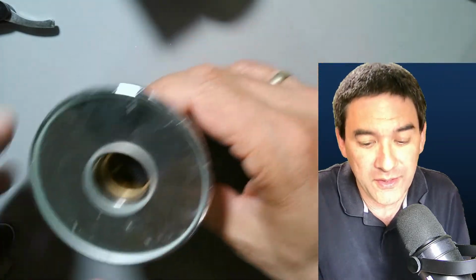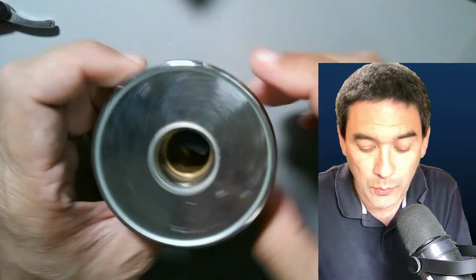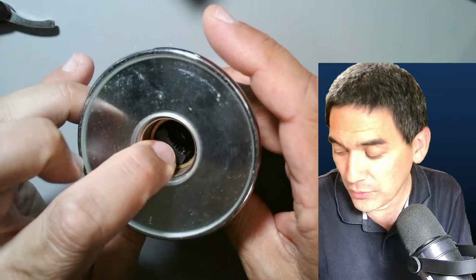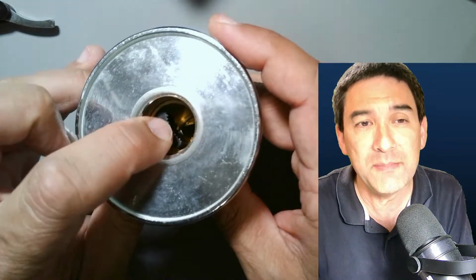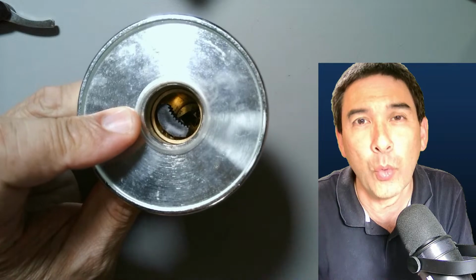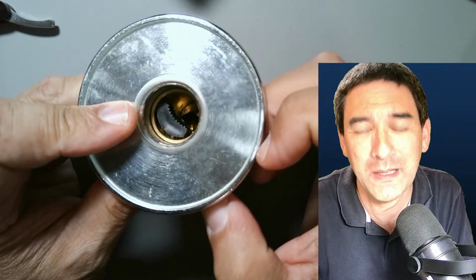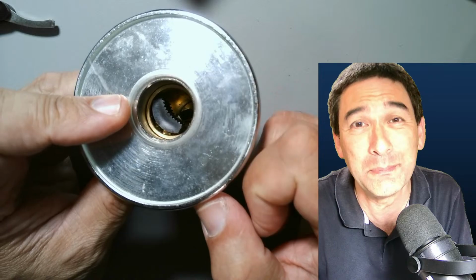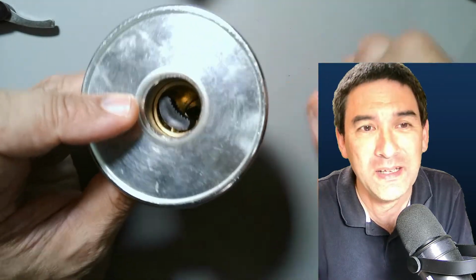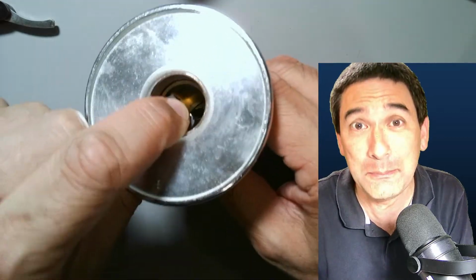Now, the one that I have over here does not have a clamp, and it still works quite well. The one with a clamp has advantages and disadvantages. Just a short intro here: if you put a specimen in here, it's only supported by the clamp, and it's a little bit wobbly. So there is some flexibility here, and this can sometimes result in the cut not being completely even. That's the disadvantage here. The advantage is that it's held quite tightly in place.